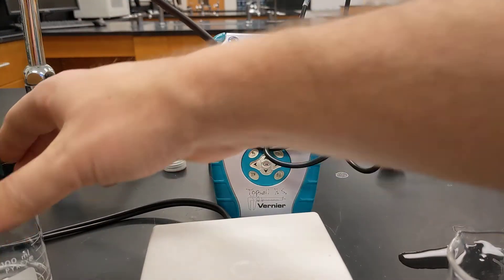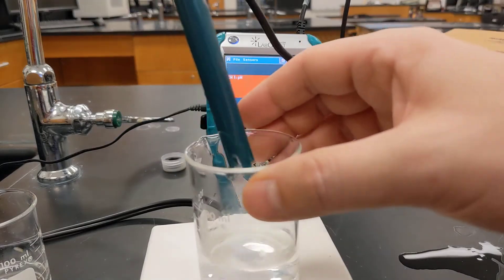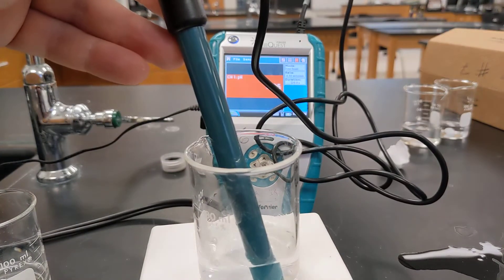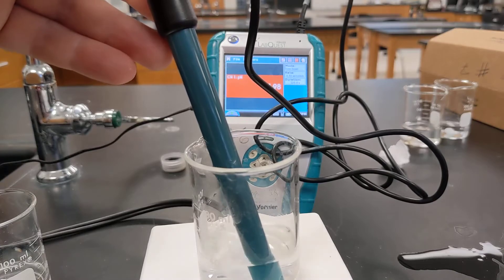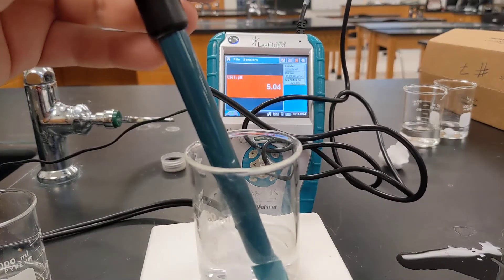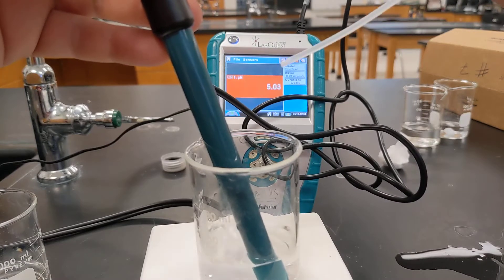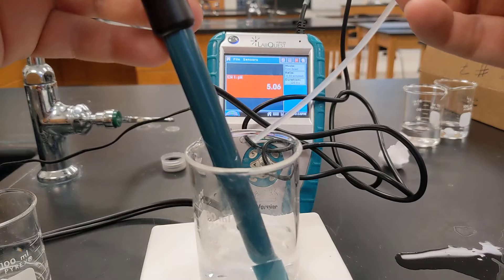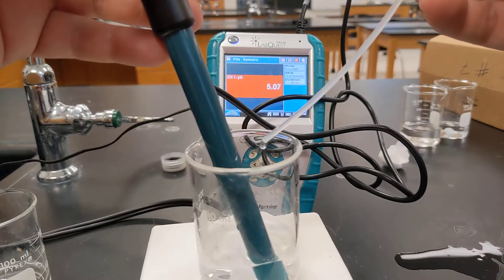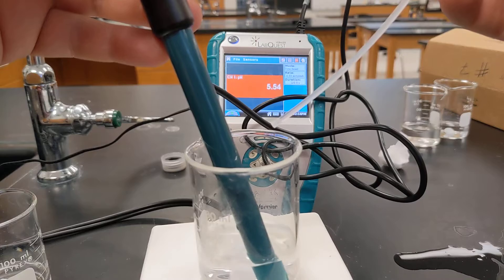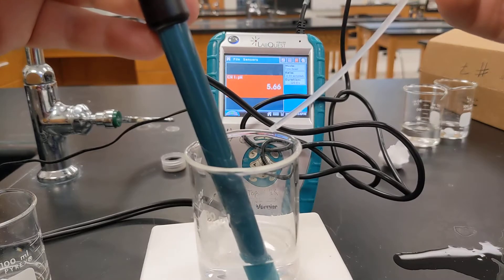Similarly, if I took a solution of distilled water and to it I add some strong base, some sodium hydroxide, which I definitely did not borrow from one of the lab groups. I'll add a single drop and that's sending the pH right on up.